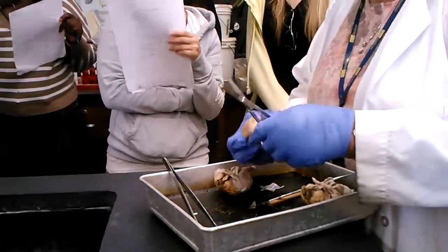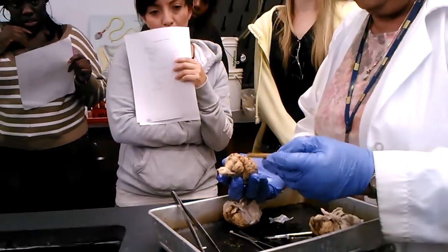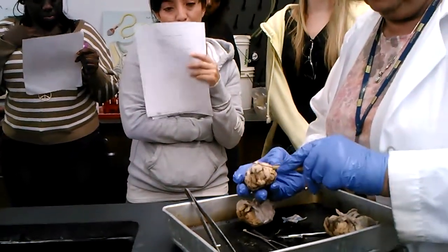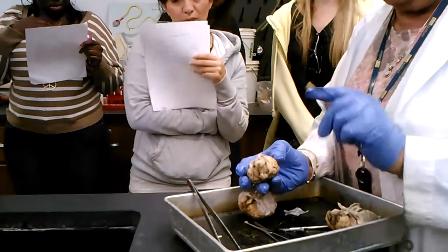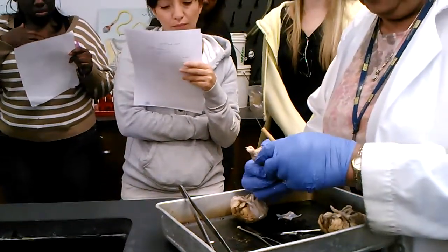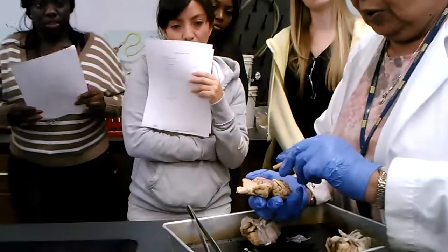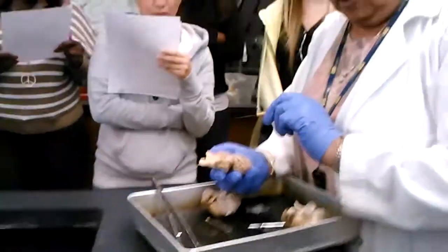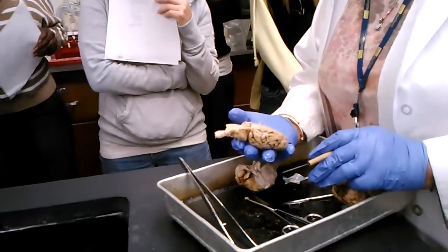Now, this one is already dissected. So what is this behind here? This is the cerebrum, so this would be what? Cerebellum. And this projection out here would be the pons, and this is the medulla oblongata. Now, when we open this, what is this that looks like a leaf, with veins in the leaves? Arbor vitae. Testable. That's the arbor vitae. And now we can open these two halves.